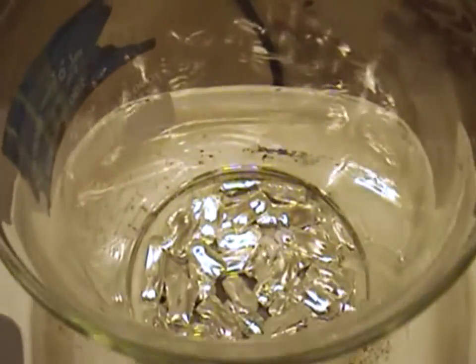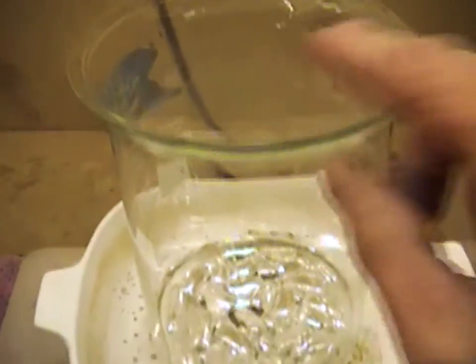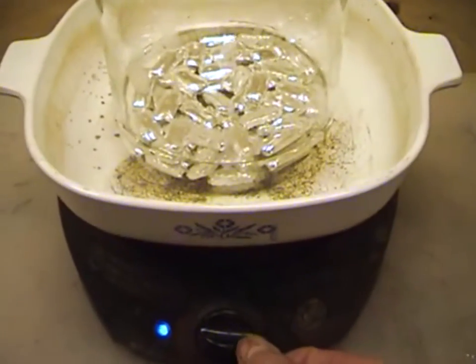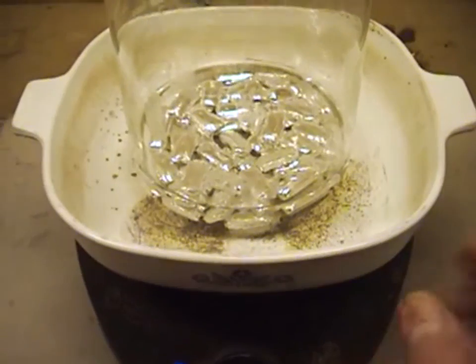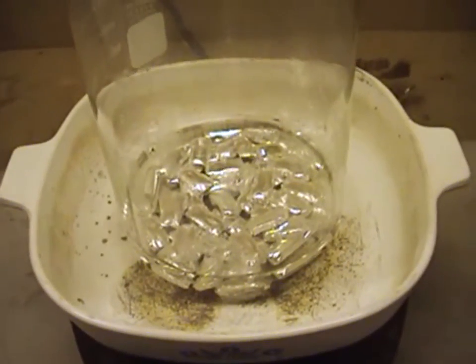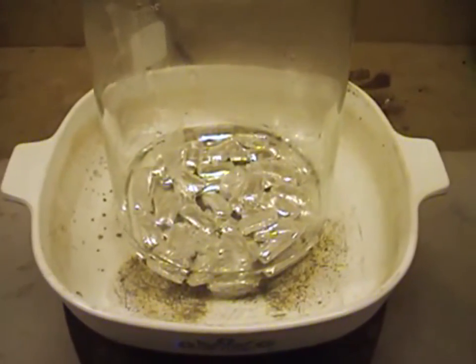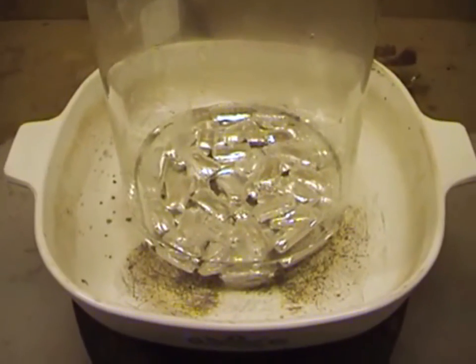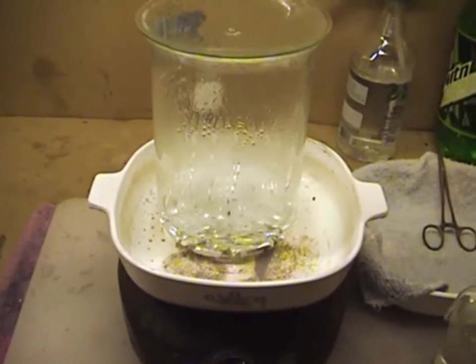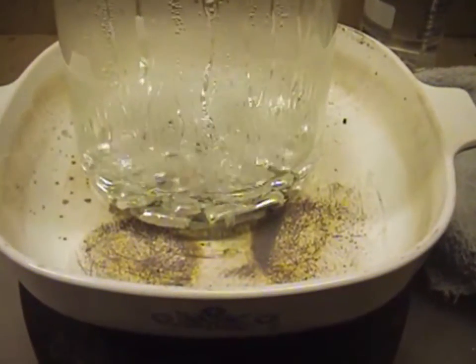You can see our bars down in there. I'm going to put my watch glass on top and turn this on to a high setting — I actually do want to boil the bars. You don't want to hard boil them, but you want to see bubbles come off the bottom of the beaker, then reduce it back to a slow simmer. You just want them to simmer in there for about a good 10 to 15 minutes. Then we're going to cut it off and let it cool.